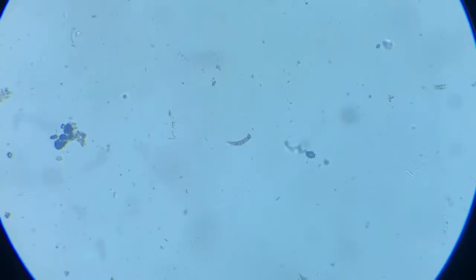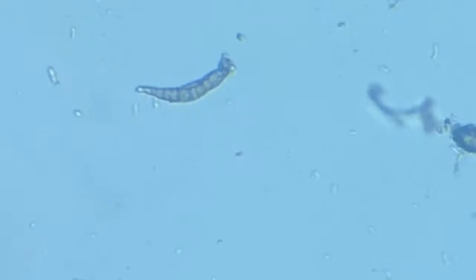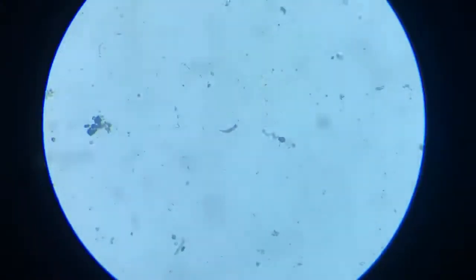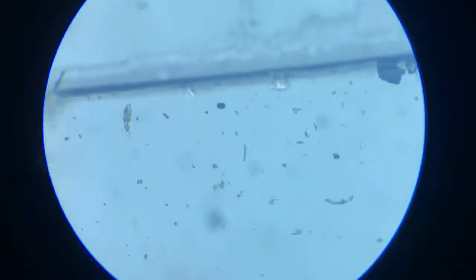That fellow is a rotifer or a larva. Since it is segmented, it is safe to presume it to be a larva and not a rotifer. There you see the segmentations of the body, or could be the cast shell of some organism. Move and try to find that fluke thing one more time, one last time.